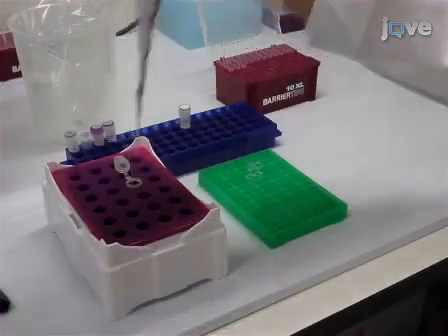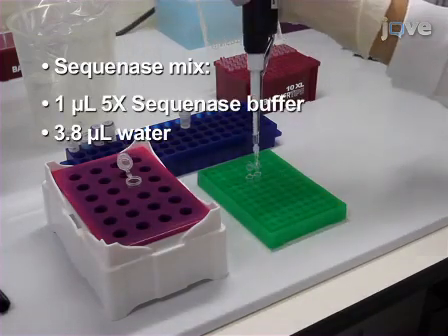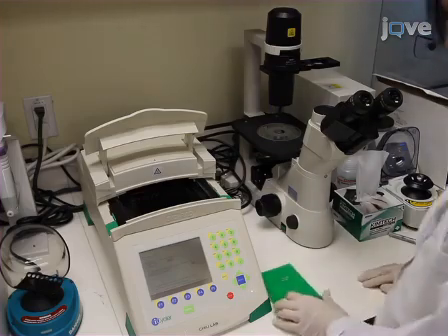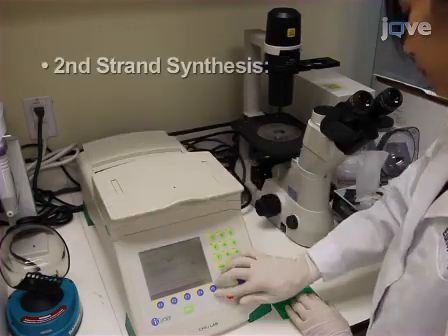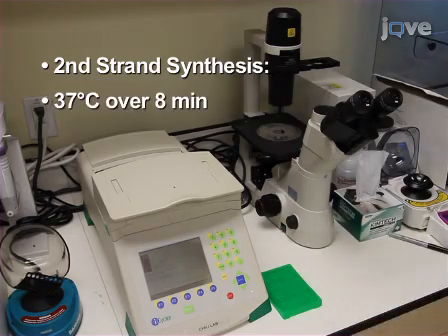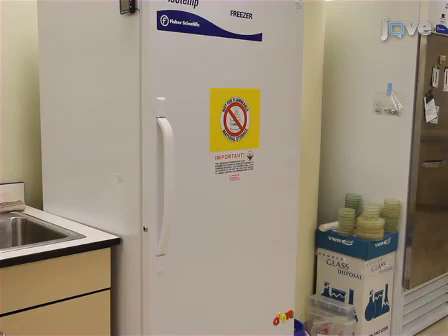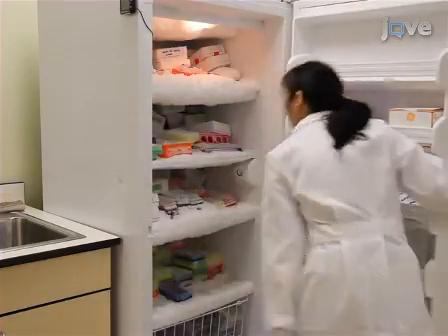Next, add 5 microliters of Sequenase mix, consisting of 1 microliter 5 times Sequenase buffer, 3.8 microliters water, and 0.15 microliters Sequenase. For second strand synthesis, ramp the thermocycler up from 10 degrees Celsius to 37 degrees Celsius over 8 minutes. Hold at 37 degrees Celsius for 8 minutes, then heat to 94 degrees Celsius for 2 minutes to inactivate the Sequenase and cool to 10 degrees Celsius. At this point, if desired, store the sample containing 15 microliters cDNA at minus 20 degrees Celsius.